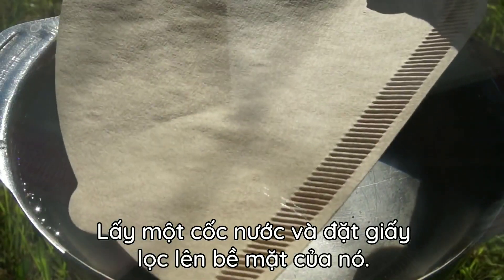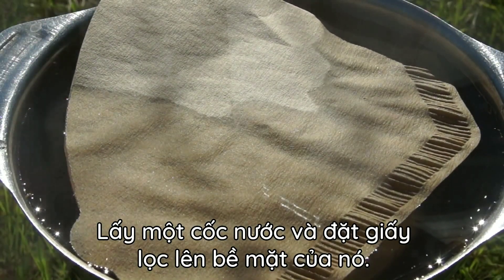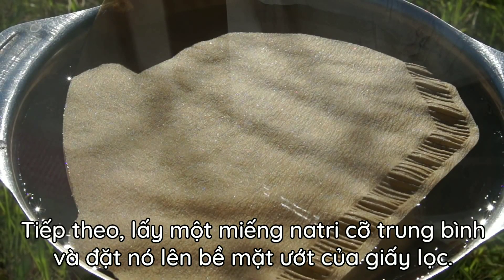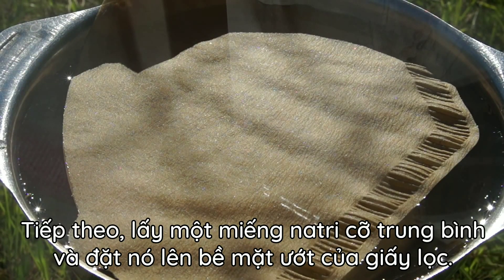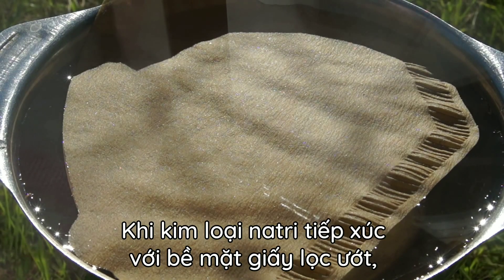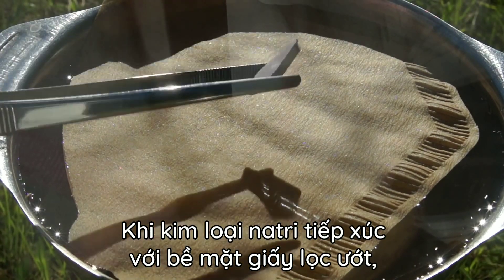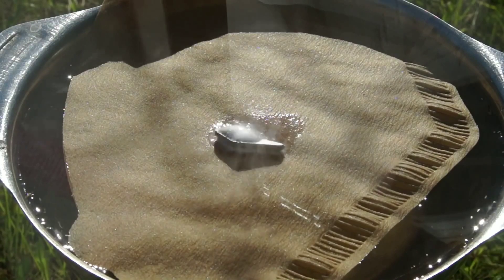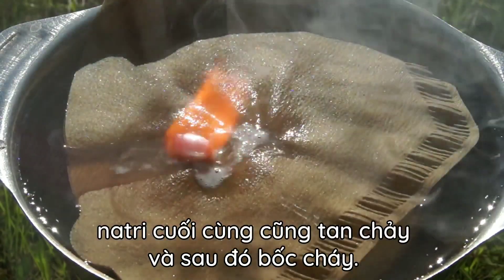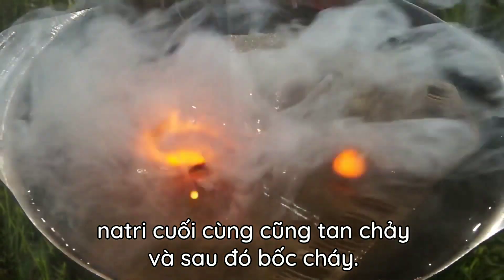Take a cup of water and put a filter paper on its surface. Take a medium-sized piece of sodium and put it on the wet surface of the filter. When sodium metal contacts with the wet filter surface, the reaction begins. As a result of the heat during the reaction, sodium eventually melts and then ignites.